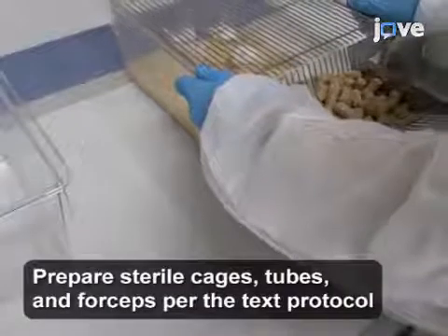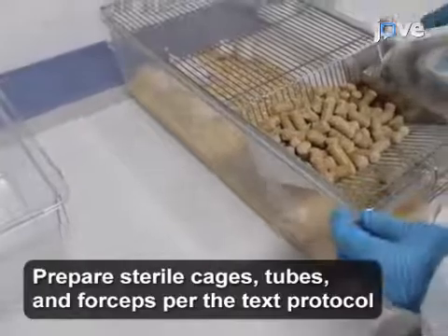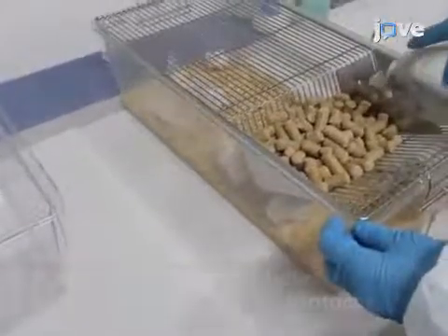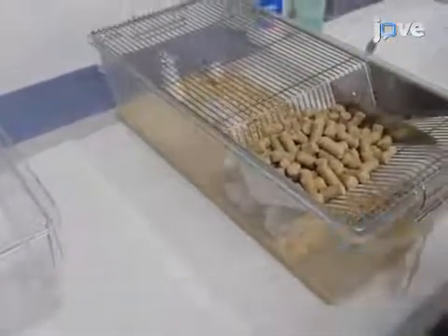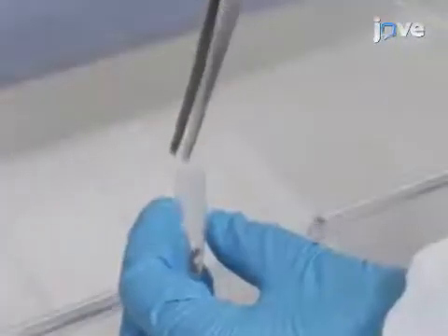After ear labeling and acclimating BALB-C young female mice according to the TEXT protocol, on day one of the experiment, collect fecal samples for each mouse.